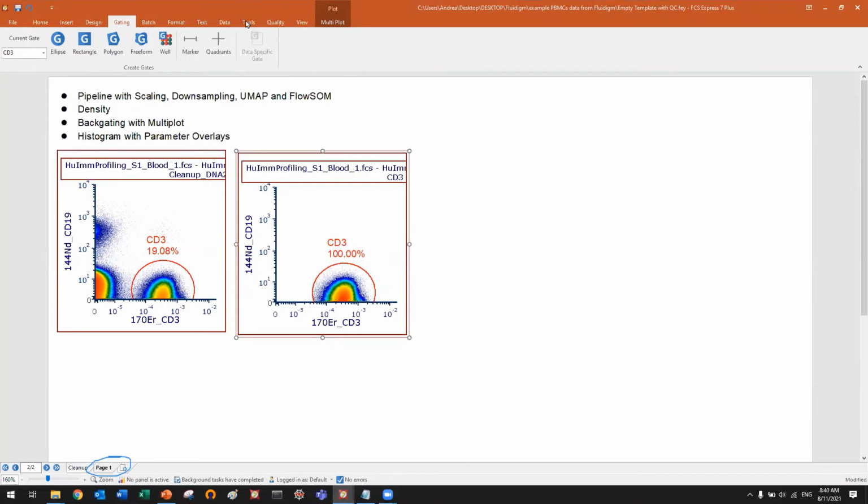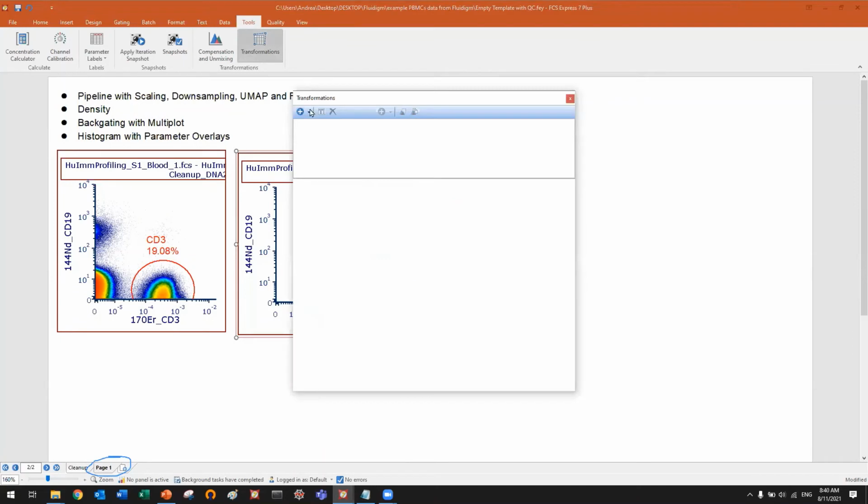And then we move to tools, transformations, and we are going to create the pipeline. You can click on this little plus and you see we have this option, pipeline. Do not care about the other options at this stage. You see we have k-means, we have SPADE, t-SNE. Those are the old ways of computing these algorithms. Those are the standalone algorithms. So you run either SPADE or t-SNE or PCA or k-means. This is the old way of doing this type of analysis. We are still keeping them just for compatibility with old layouts. But nowadays people just go straight to pipeline.